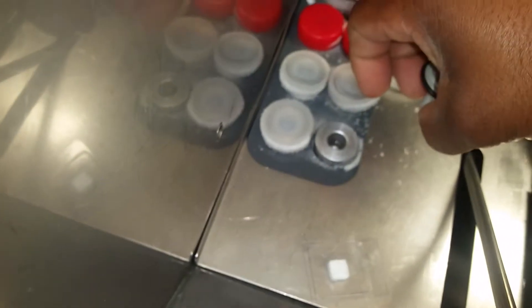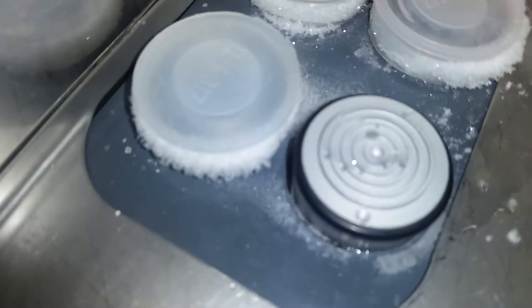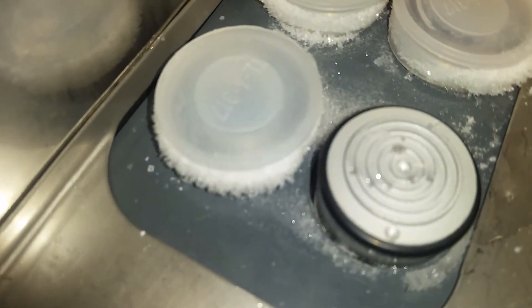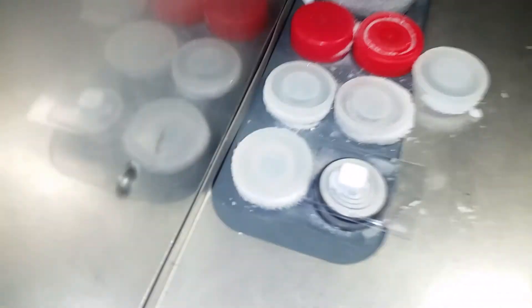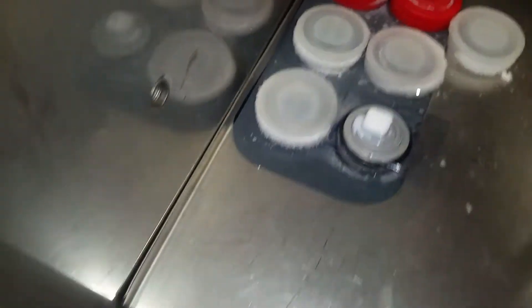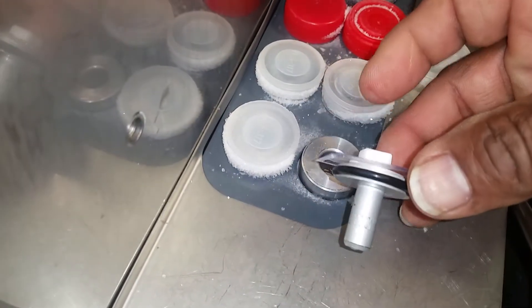I'll open up an area here on this bar inside the cryostat and place that in. I'll put my phone inside the cryostat to show you what's going to happen. You'll begin to see that OCT start to freeze — it's happening now. I'll place the block on top of there before it solidifies, and you've got an attached block to a chuck, just like so.